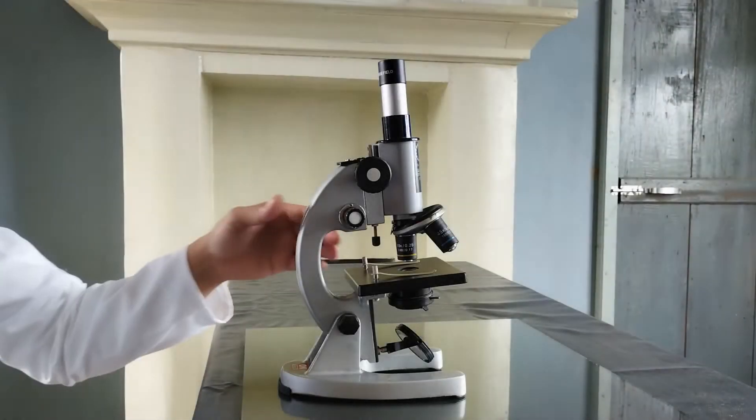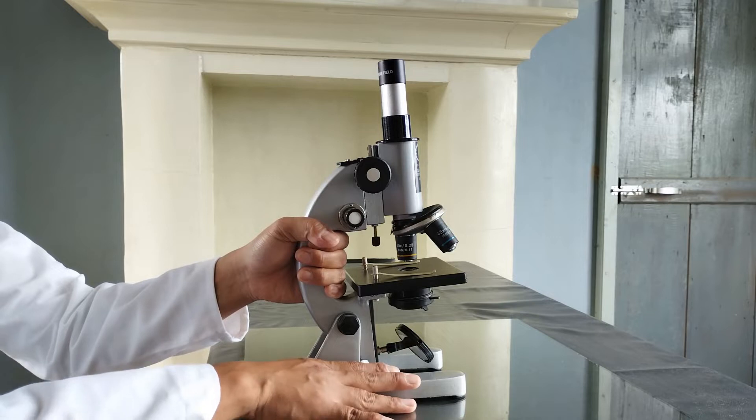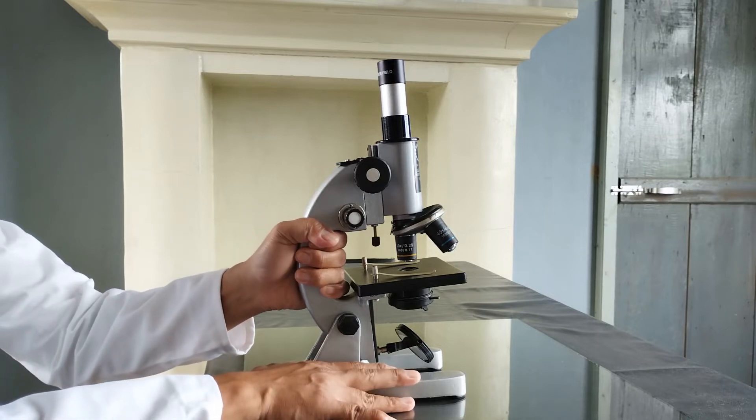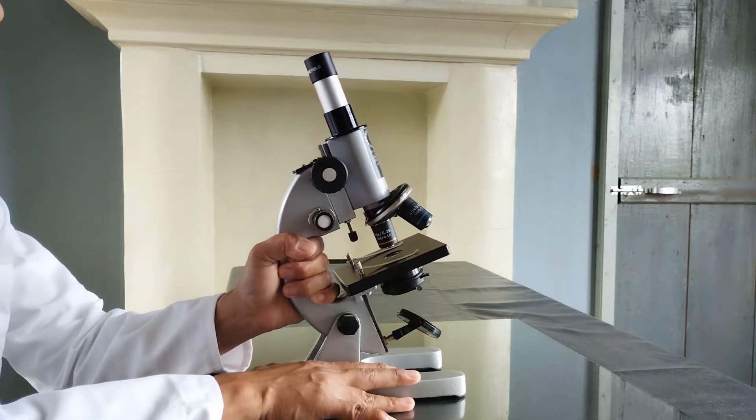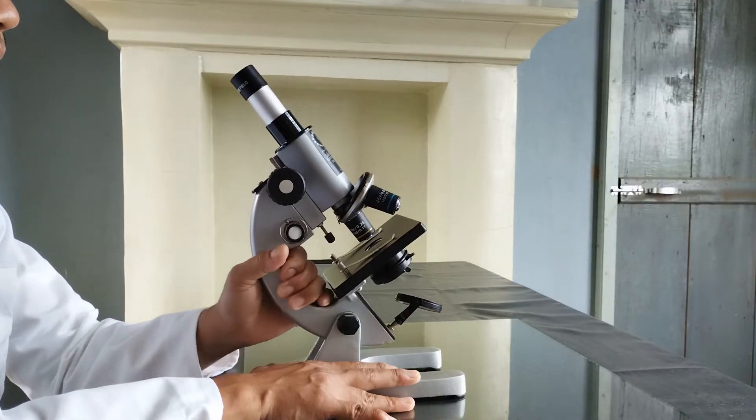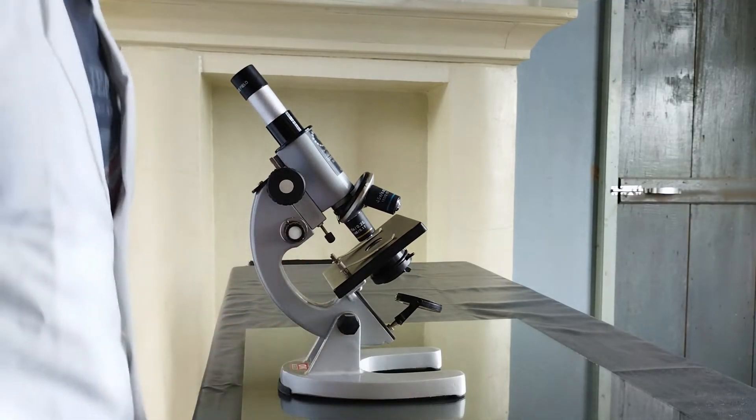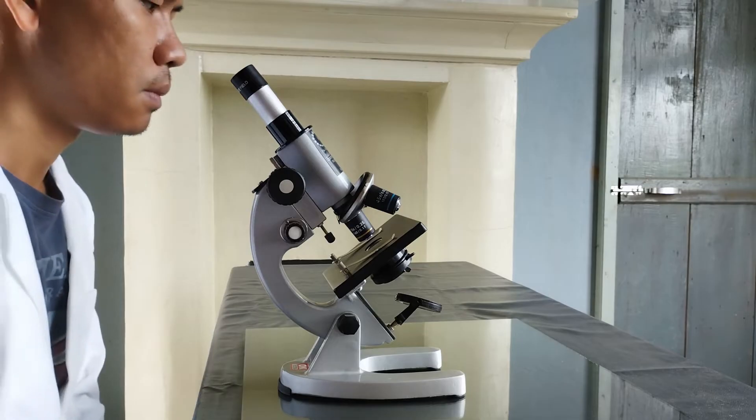Now, holding the arm of the microscope firmly with one hand and pressing the base firmly with the other, gently incline the body of the microscope to the extent where it becomes most comfortable for the user to look through the eyepiece without causing strain to the neck and shoulders.